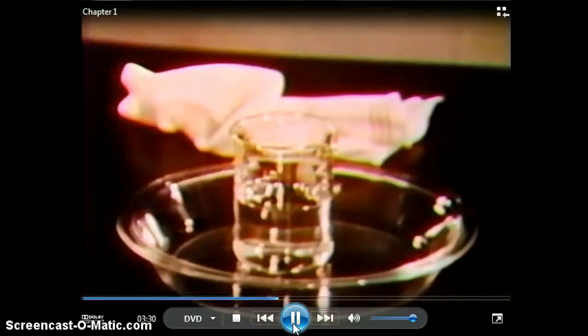To illustrate the rapidity and violence of a reaction of sulfuric acid, watch what happens when concentrated sulfuric acid is added to a sugar solution. Sulfuric acid is a powerful dehydrating agent. The sugar molecules are dehydrated rapidly, leaving carbon. The resulting steam causes a very noticeable expansion in the volume of the carbon. Had someone been holding this beaker when the acid was added, his hand would have been encased in scalding carbon black.